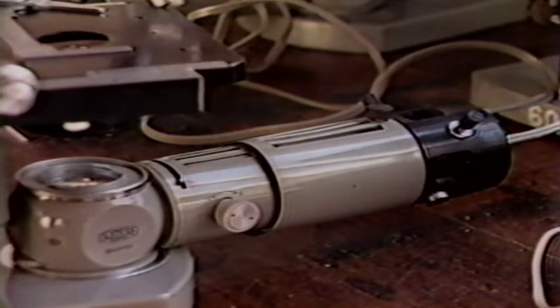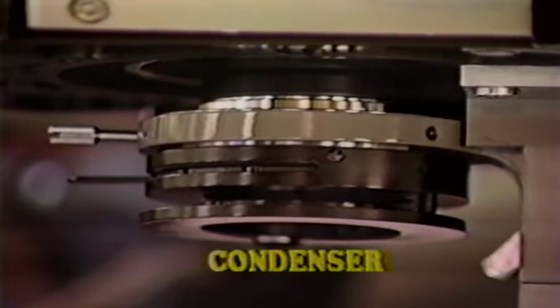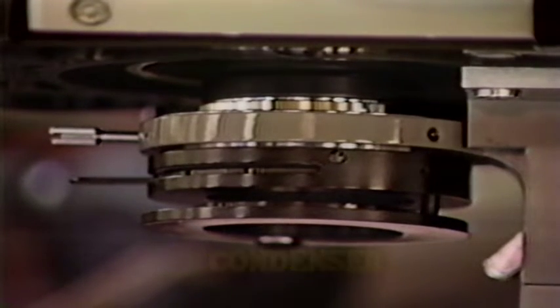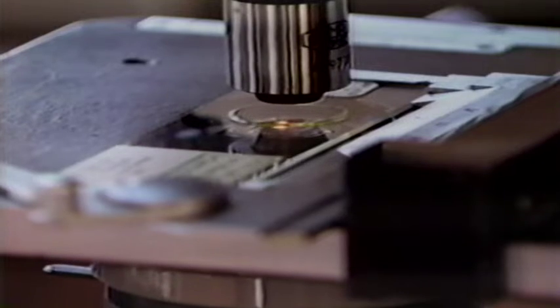Most student microscopes contain a lamp, which is simply turned on to illuminate the specimen. Some microscopes also contain a third knob, which controls the vertical movement of the condenser. Condensers are usually a special series of lenses which serve to concentrate or condense the light reaching the sample. Adjusting the condenser enables you to control the degree of illumination of the image.